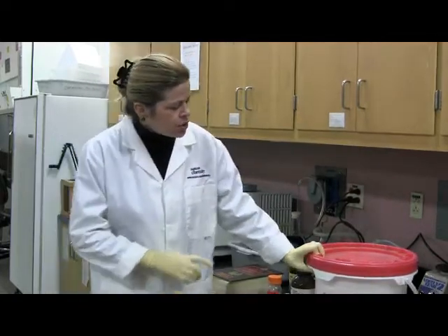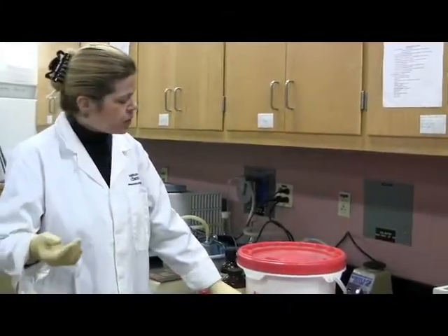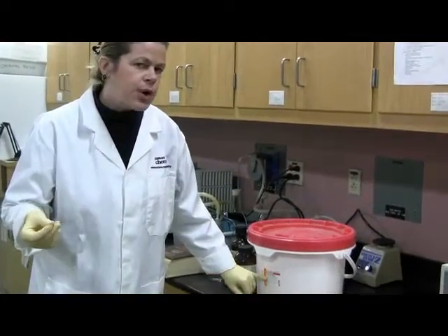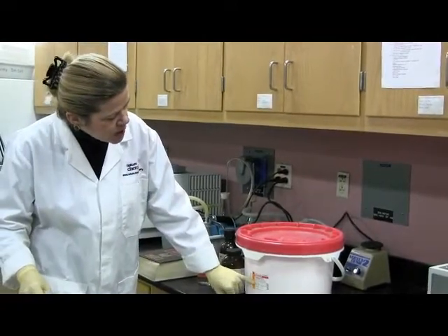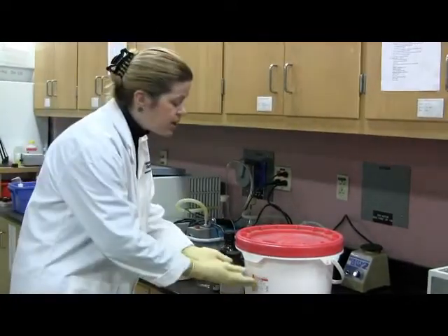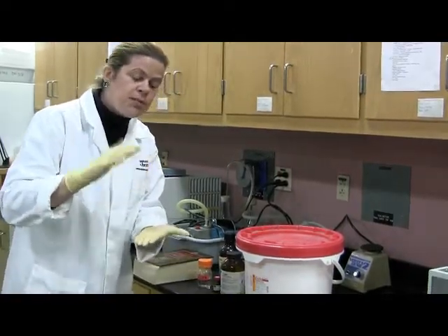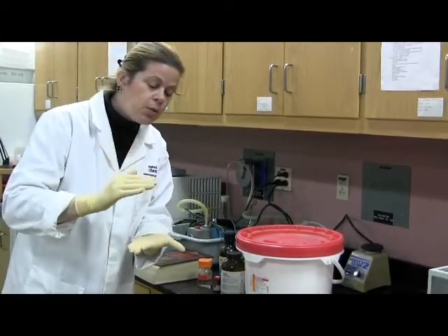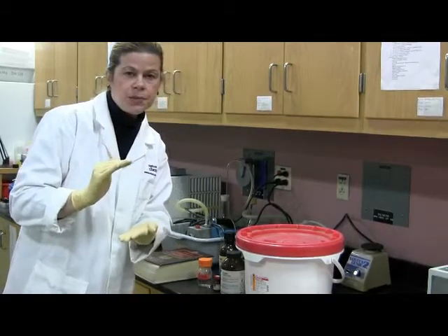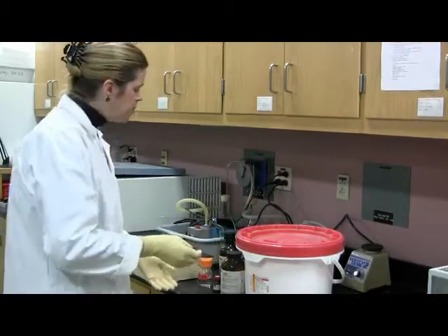So how do we do that? Let's say you want to make a 50 millimolar tris buffer. Okay. And this also has some calcium chloride in it, according to the procedure, right? So to make the tris buffer, let's say you want to make 40 millimolar. So you're going to weigh out enough tris to make 40 millimolar, okay? And if you want to make, let's say, 500 milliliters of buffer, you will only put in water to, say, 400 milliliters. So you leave extra room, and then after you prepare that, you're going to pH it.